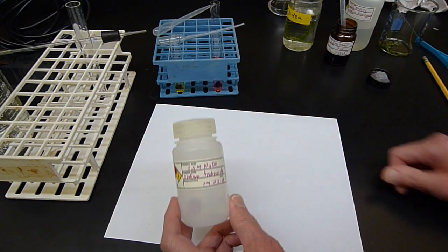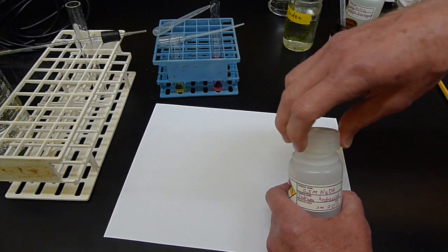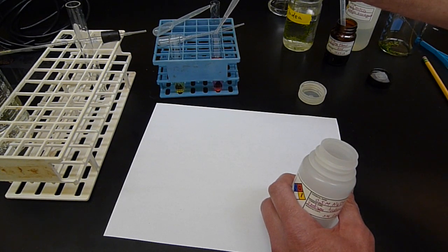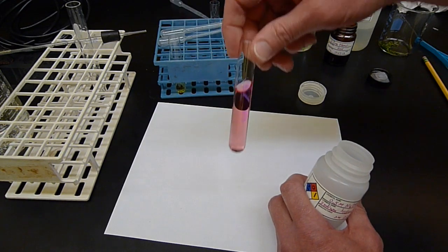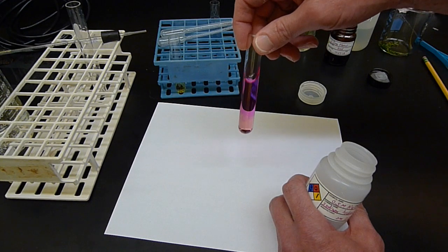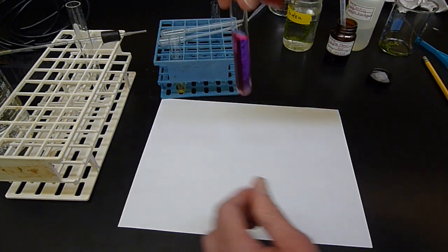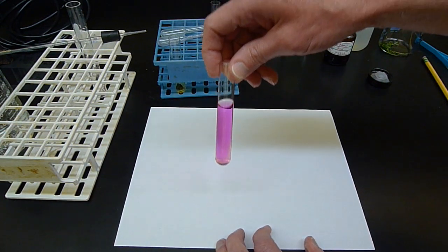So here is some base. Here's some dilute sodium hydroxide. This will be a base. I'm going to put it in this tube, and we'll see what happens to the color. And again, I'm only going to put a drop in. Now, it's red to begin with, I know, but if you can see that shade changes a little bit. It gets more of a fuchsia red, right? That's the description. This is no longer just red. It is fuchsia. But it does change shades.